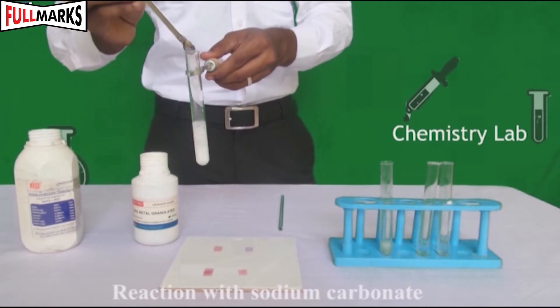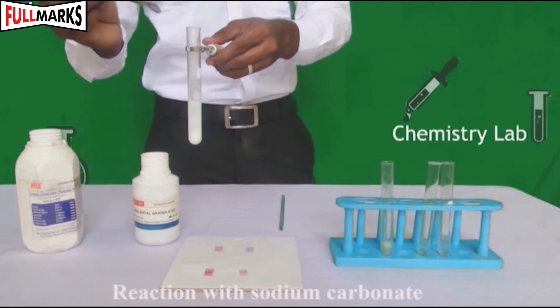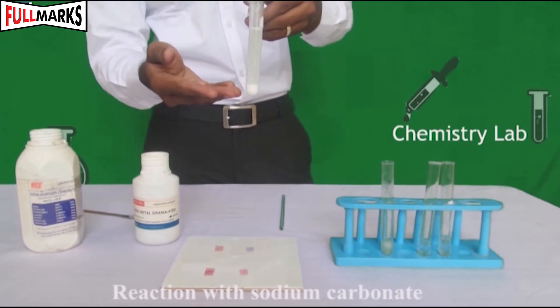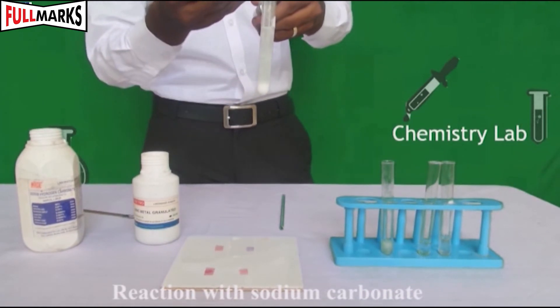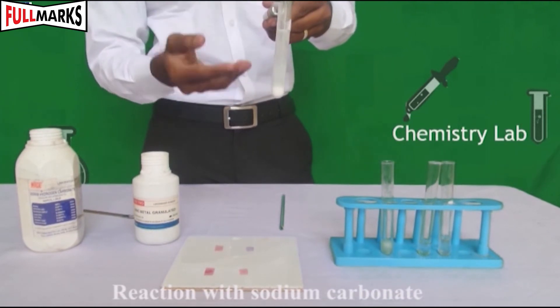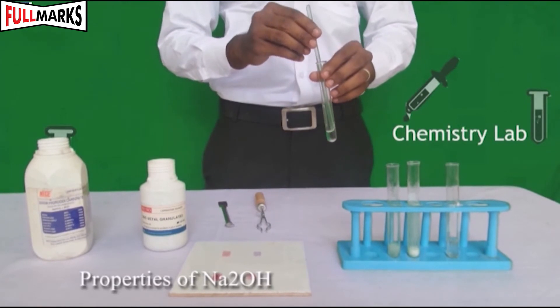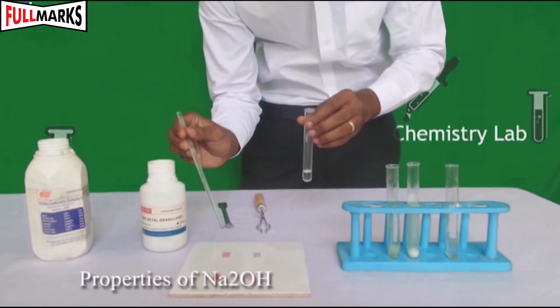HCl reacts with sodium carbonate to release a colorless gas. Take dilute NaOH and add a drop of blue litmus solution in one test tube and a drop of red litmus solution in the second test tube.